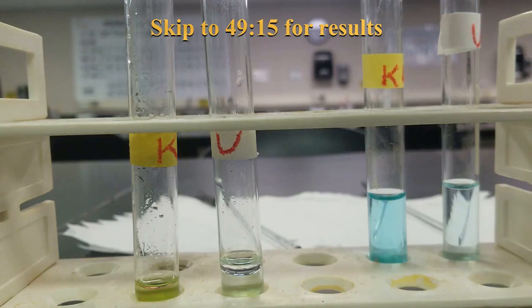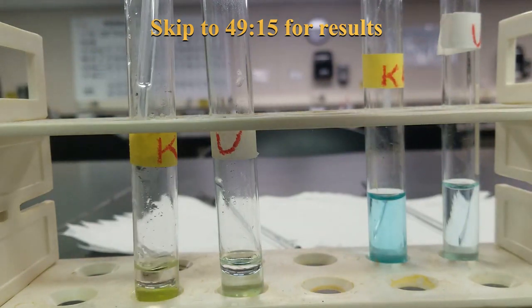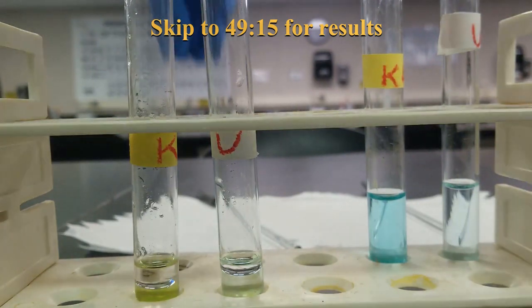More toluene. Hopefully we don't have pink this time.